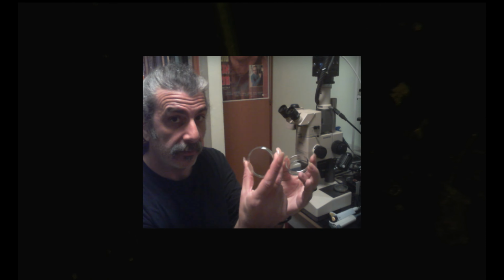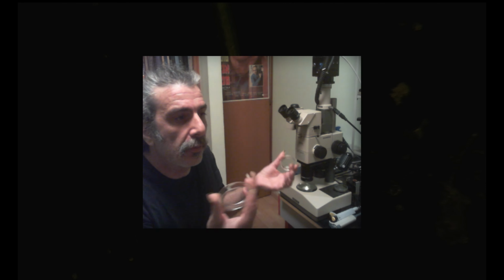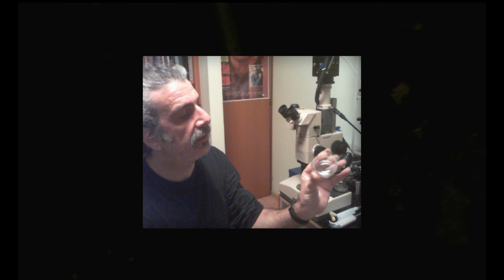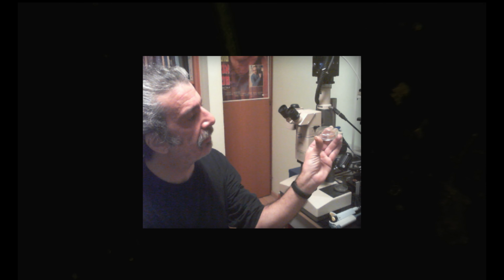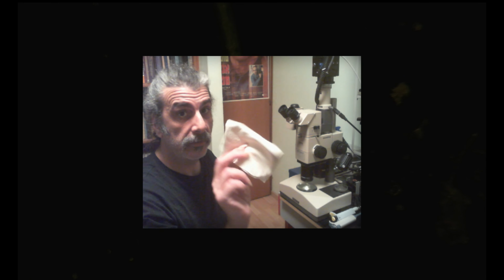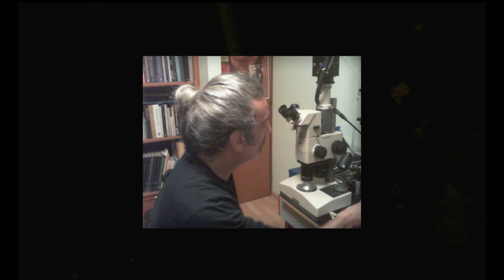They are very flat, which is very convenient when we're focusing. You don't need to refocus when you're watching. Also great for the inverted microscope. They are not expensive. Try to get them. The brand name is Duran and the model is Steriplan. Then we have cloths for cleaning, or another microfiber towel.